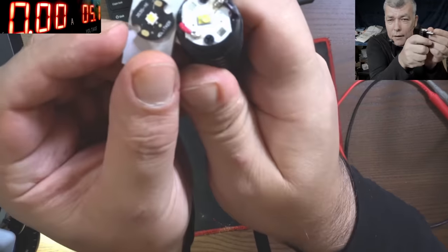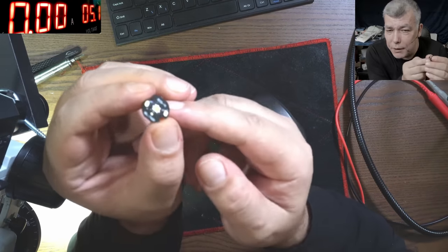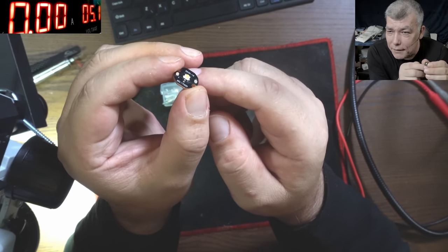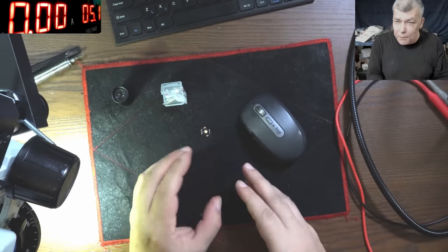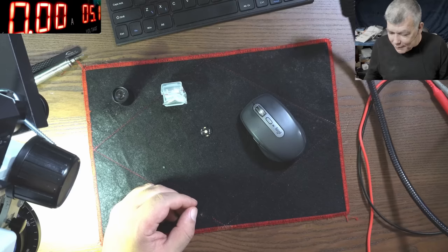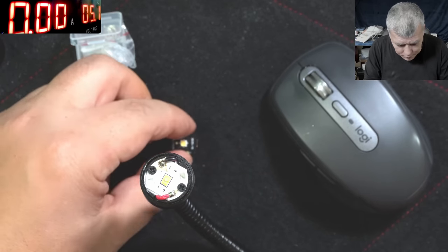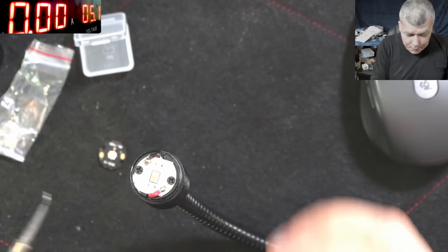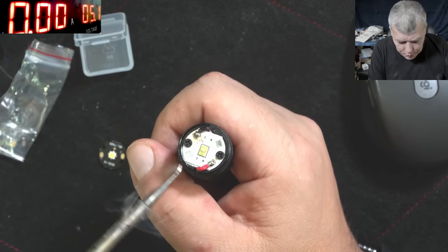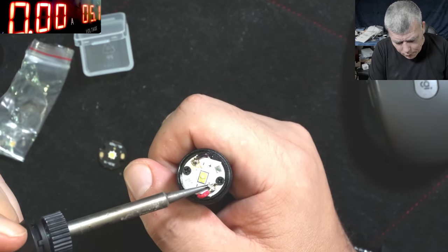This is the original LED and this is the new one — we can swap them directly. I've seen people on YouTube taking these and cutting down the diffuser, but I prefer them with the diffuser on. You can do crazy things with something like that. Let's desolder this one and swap it with the other one. The power supply is an Apple charger which outputs only about 2.4 amps, so I'm curious what will happen.